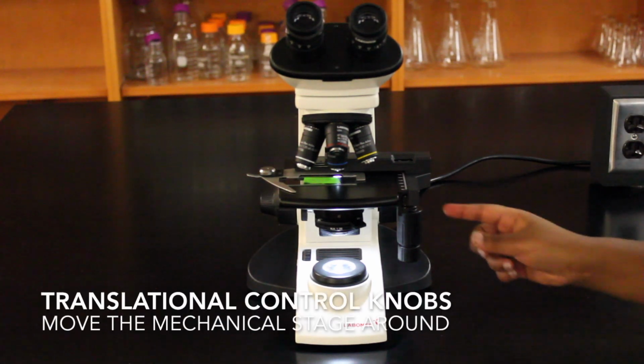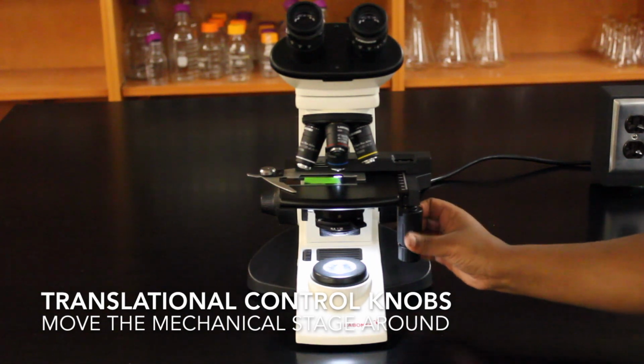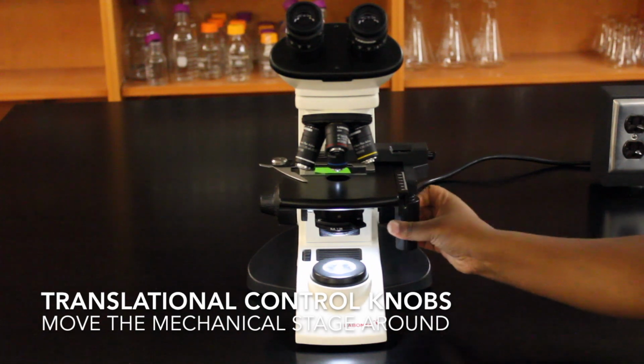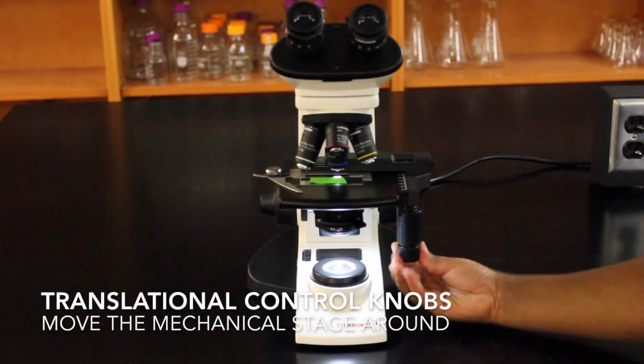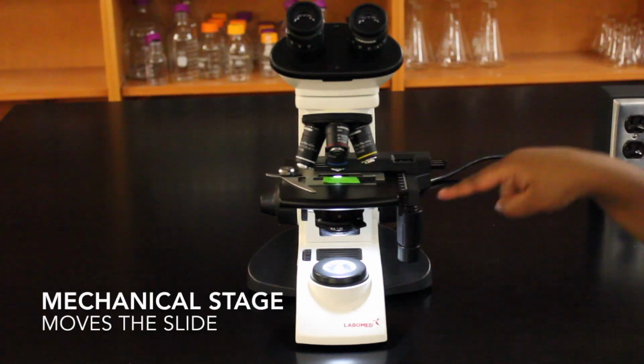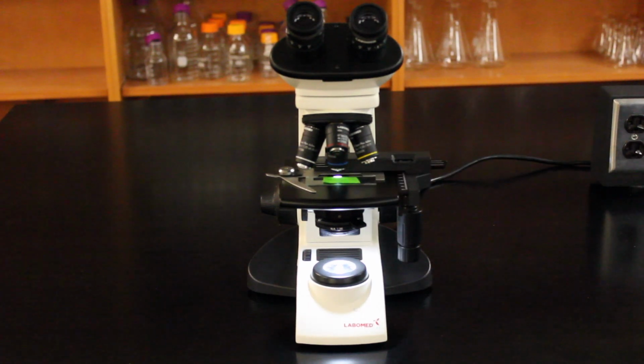The translational control knobs will move the mechanical stage around, moving the slide horizontally. So the mechanical stage is the black and silver part that is moving here. And these translational control knobs are used to move the slide horizontally.